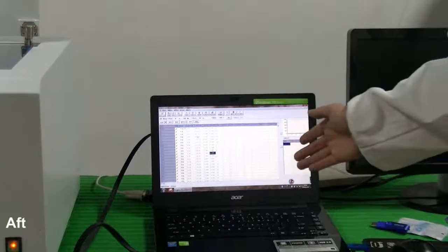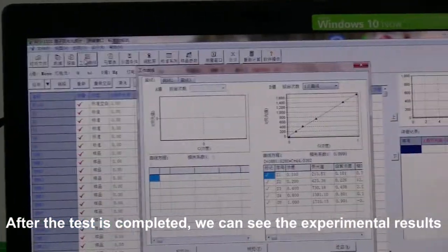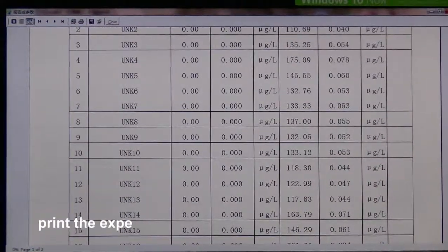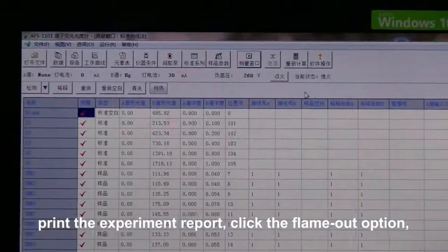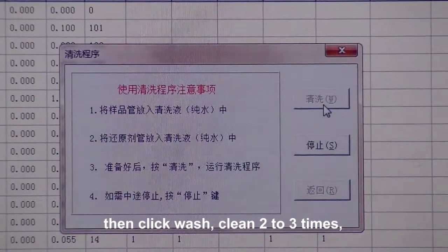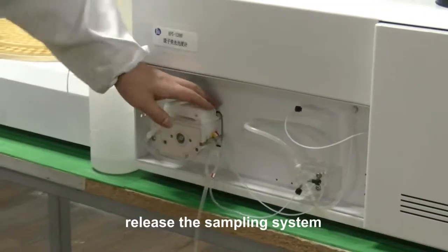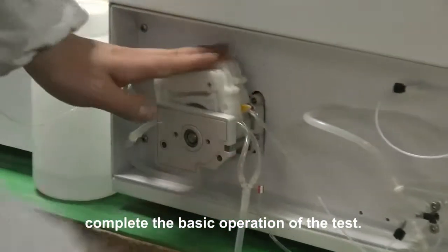Step 6 — Turn off the instrument. After the test is completed, view the experimental results and print the experiment report. Click the flame-out option, then click Wash. Clean 2–3 times. After cleaning, click Return. Turn off the software workstation and release the sampling system to complete the basic operation of the test.